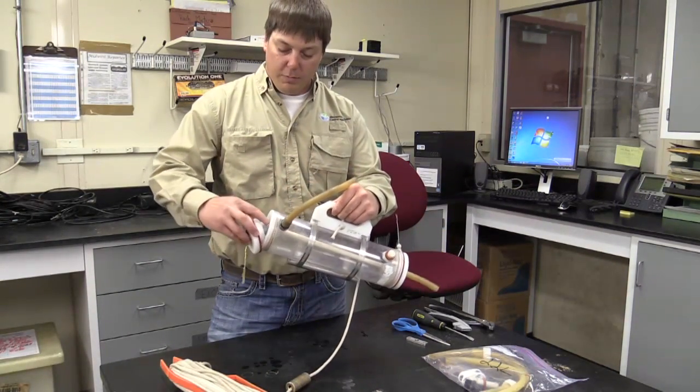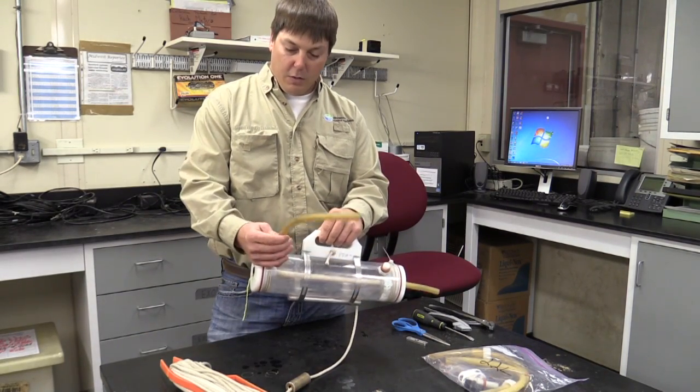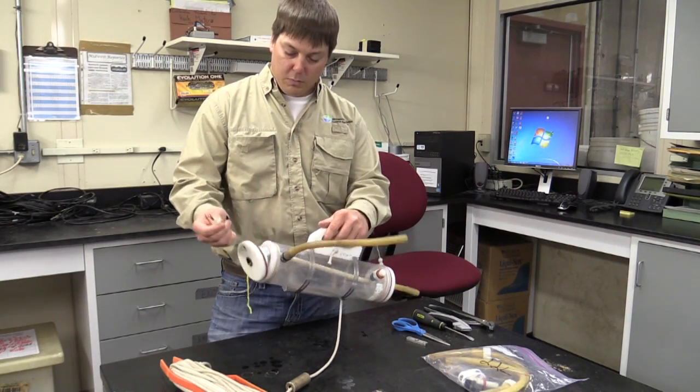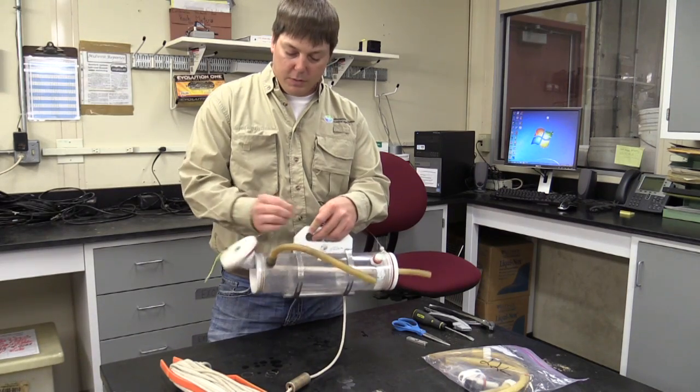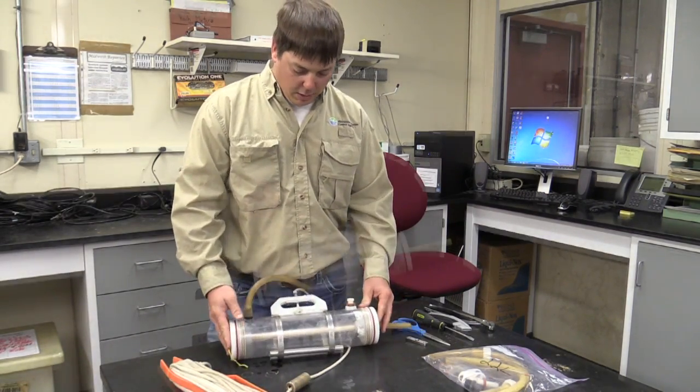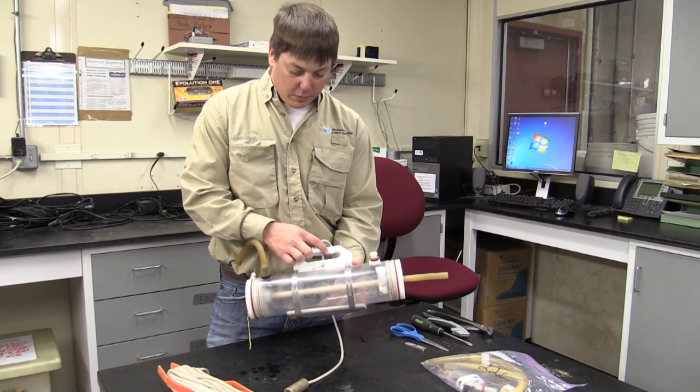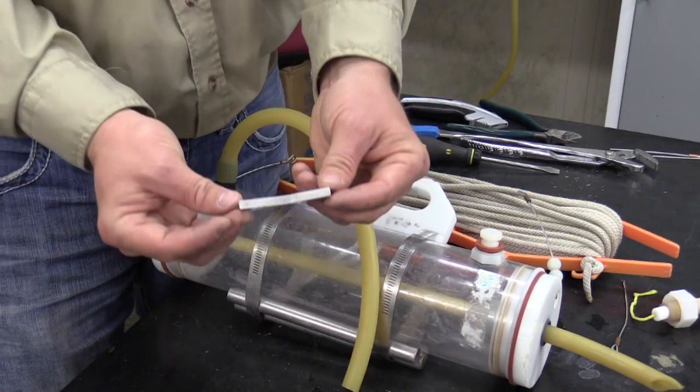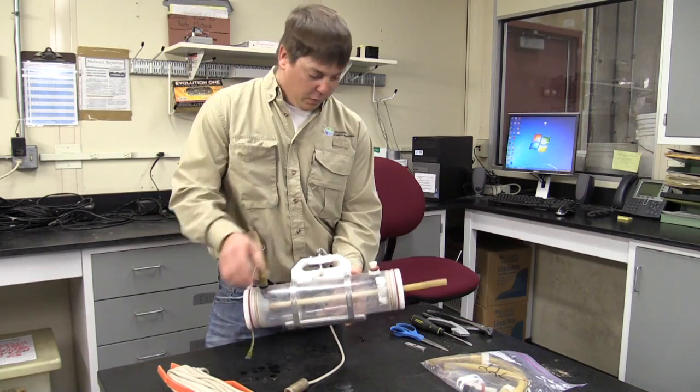I'll show you how to replace this inner tubing. I'll also show you how to replace this rubber drain hose and also one of the little cables that hold the trap doors down. Another thing that tends to wear out from time to time is these trip plates right here are aluminum and they bend, and it makes for not quite as easy operation of the doors and everything.